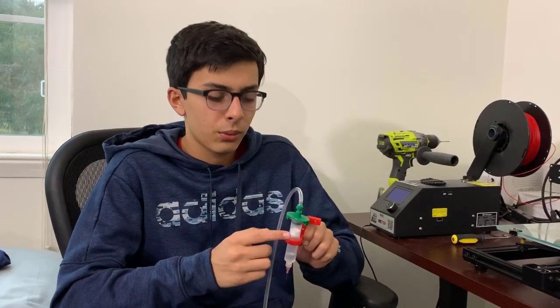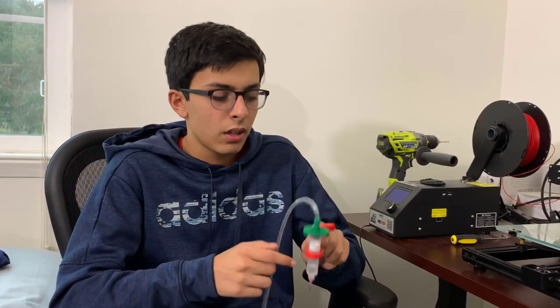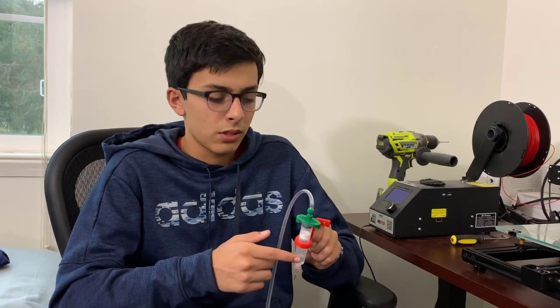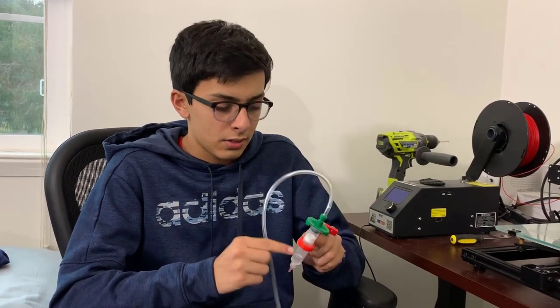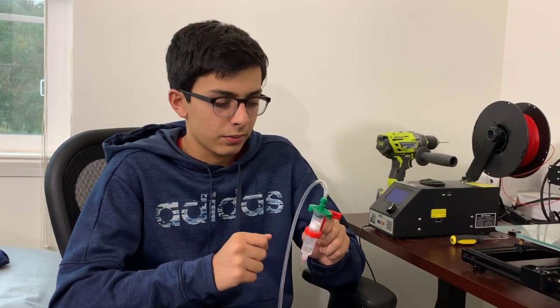You will also need syringes and syringe tips. We're using 25 cc syringes and you will need tubing that connects the syringe to the EFD dispenser.